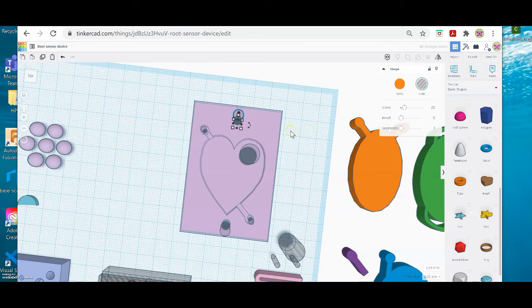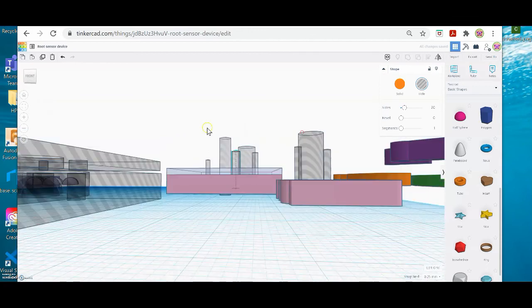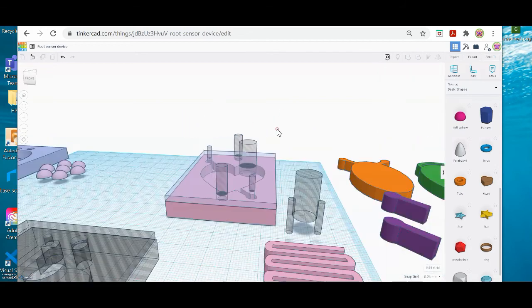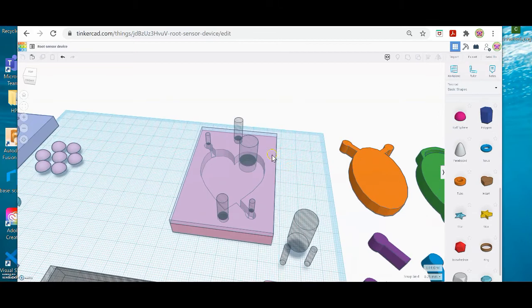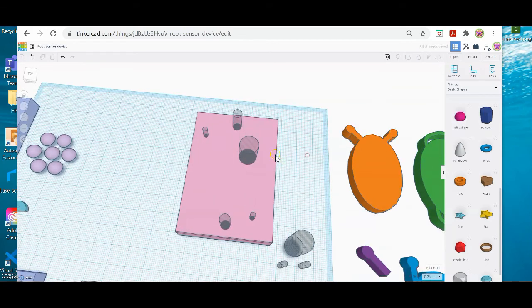I think that looks better. And now I'm going to group only the objects on the lid. And so you really want to go sideways for that. So as you can see, I've orbited to the side. And now I'm going to grab all of my objects. But before I do that, I need to turn the lid to a solid color again. I'm going to turn it back to pink. And okay, so this is what I have.